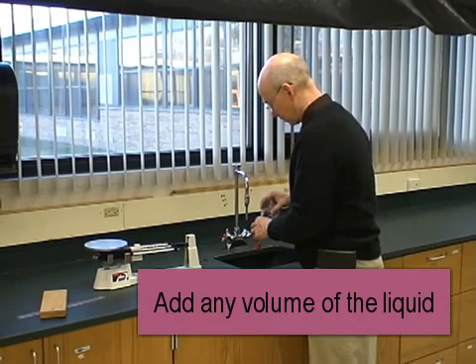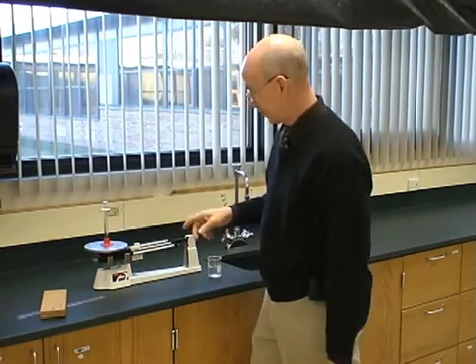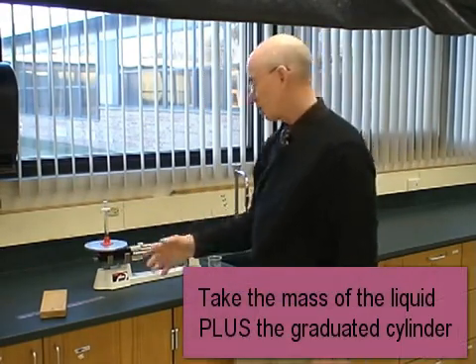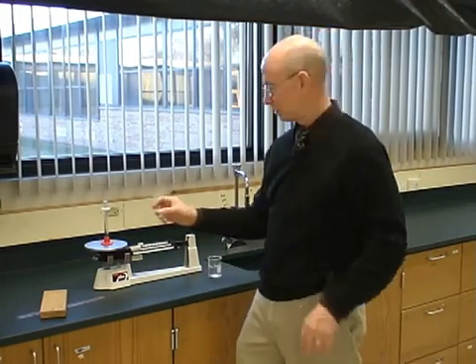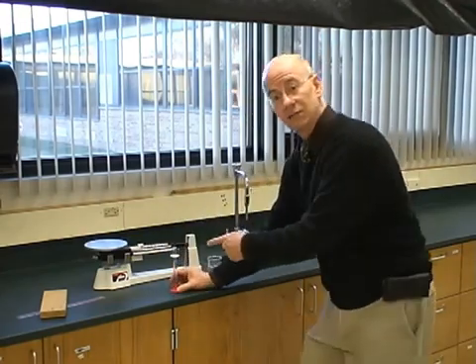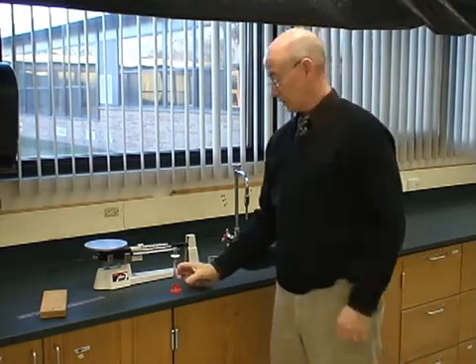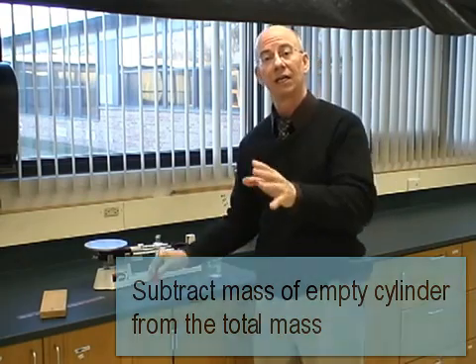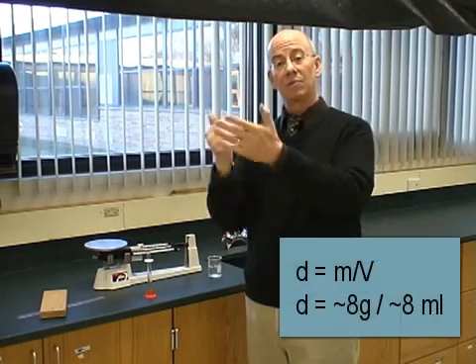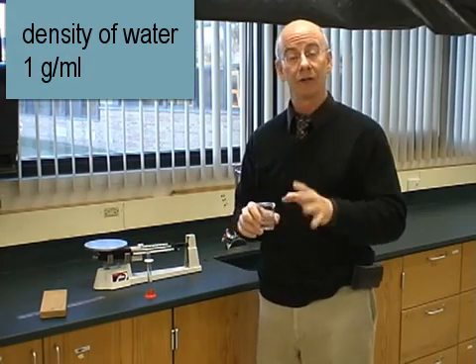I know the mass of the cylinder, so I put in any measurable volume of the liquid — making sure not to overfill. I take the mass again: it was 25.0 grams and now it's about 33 grams, so the mass of the liquid is about 8 grams. The volume reads 8.0 milliliters directly. I divide 8 grams by 8 milliliters and get 1 gram per milliliter — so this liquid is water. That's an intensive property.